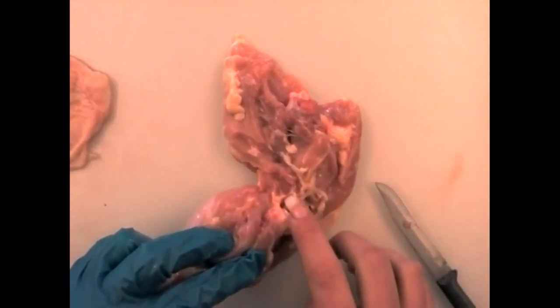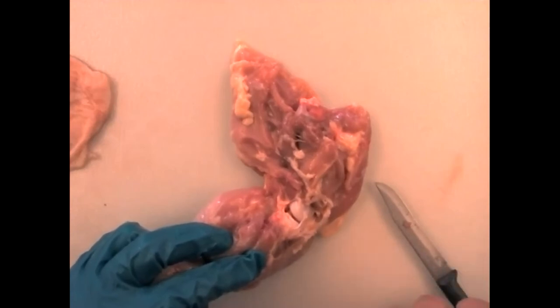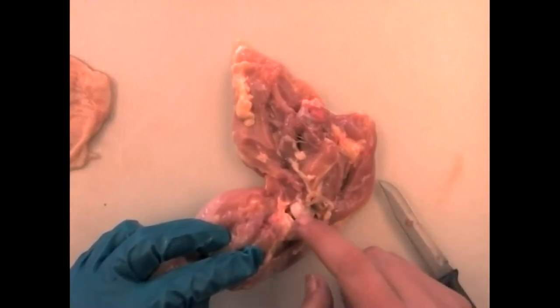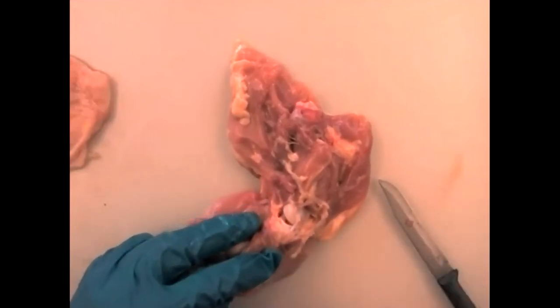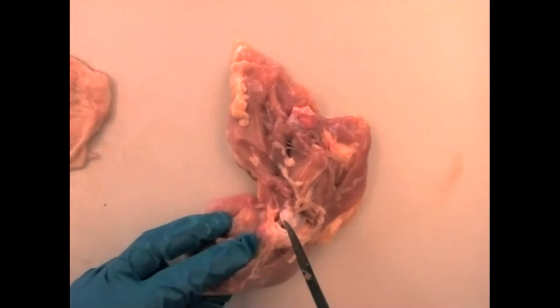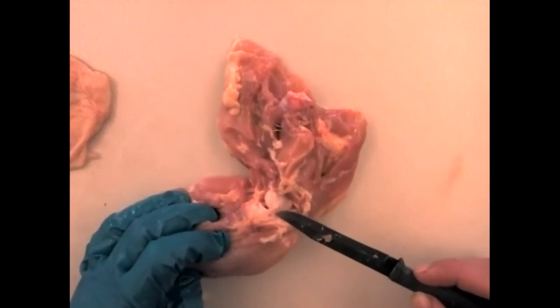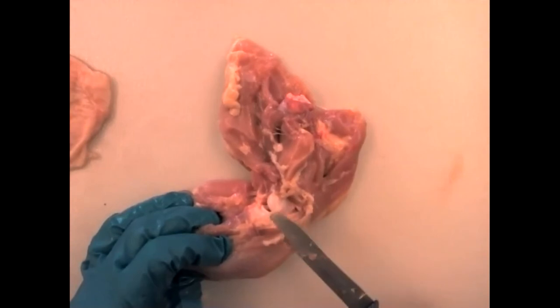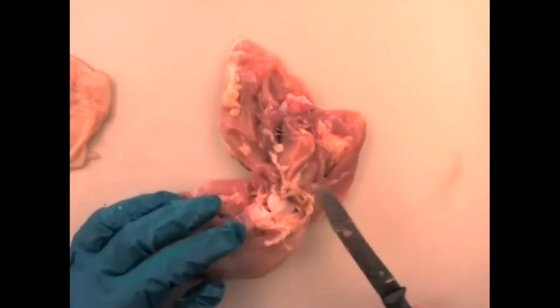When you feel the condyles, if you're not wearing gloves, you can feel a slimy goo — this is synovial fluid. It acts as a lubricant in your knee. If you damage your knee enough, you need extra fluid because the synovial fluid can't keep up. Tell me these are the condyles — the medial condyle here and the lateral condyle farther back. You'll also see a collateral ligament — a flappy white thing that helps stabilize the knee so the drumstick doesn't swing left and right.